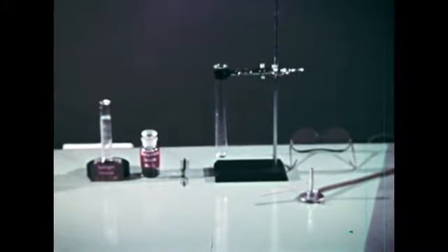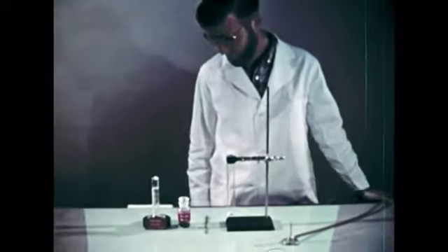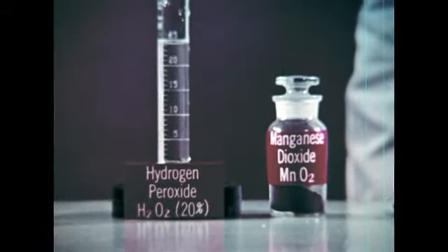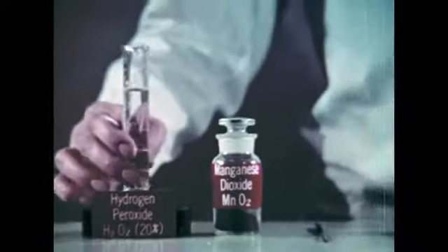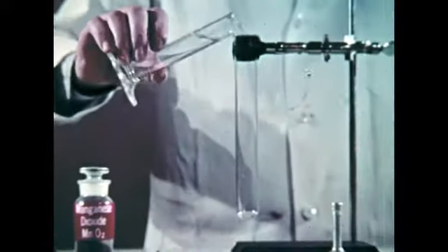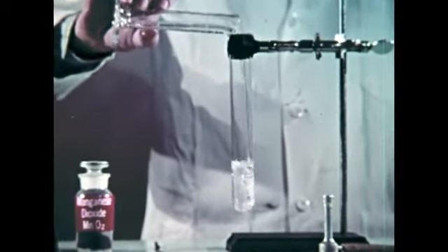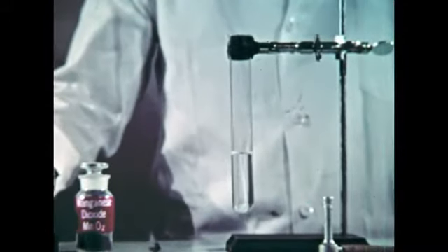This time we'll collect oxygen from a stable liquid using a catalyst. Although there are still unknowns in the catalytic process, it is thought that the catalyst provides handholds for the reactants to grab onto. We're using hydrogen peroxide for the liquid and manganese dioxide as the catalyst. Hydrogen peroxide will oxidize materials directly at high concentration and is used as an oxidant in liquid-fueled rockets without the intervention of a catalyst to produce the oxygen first.